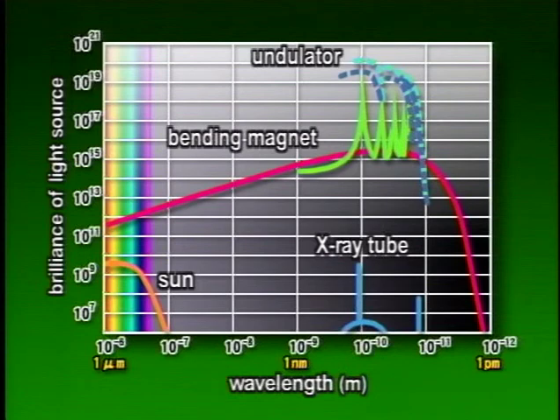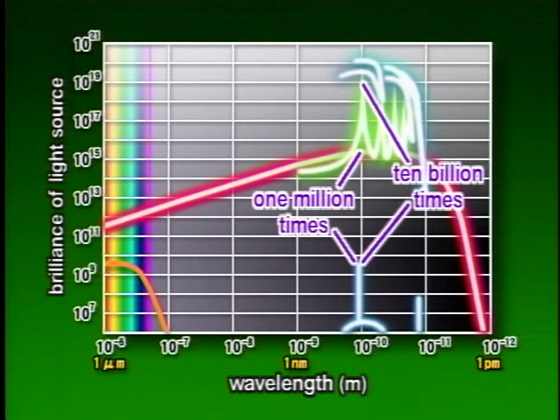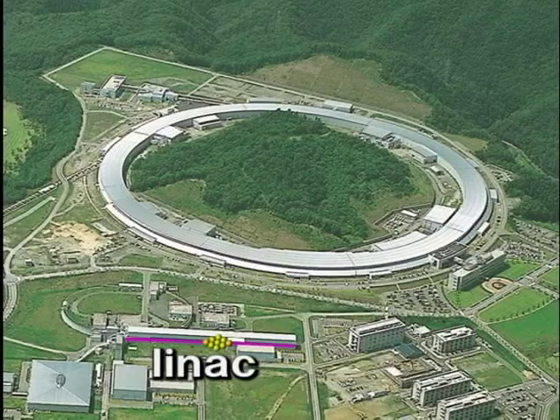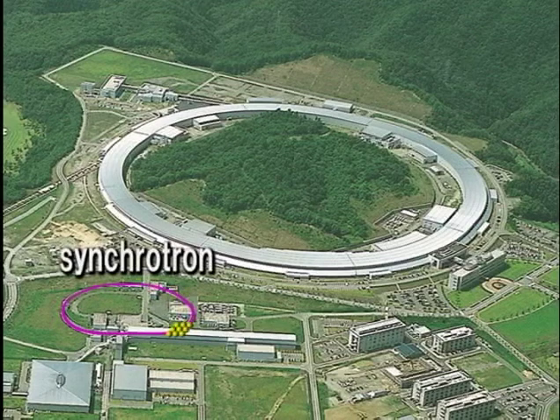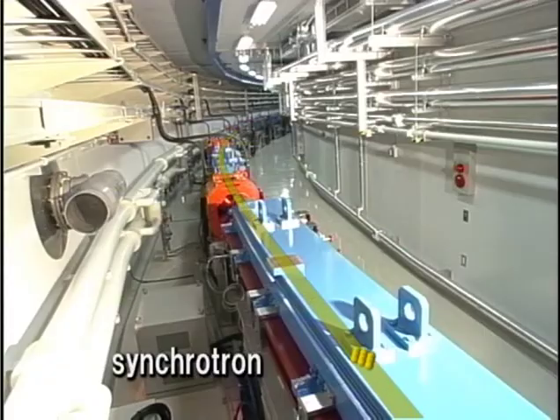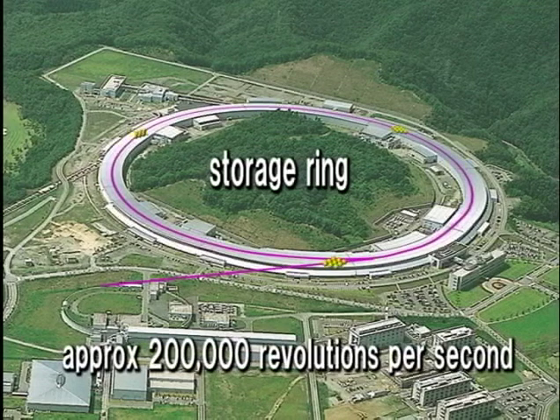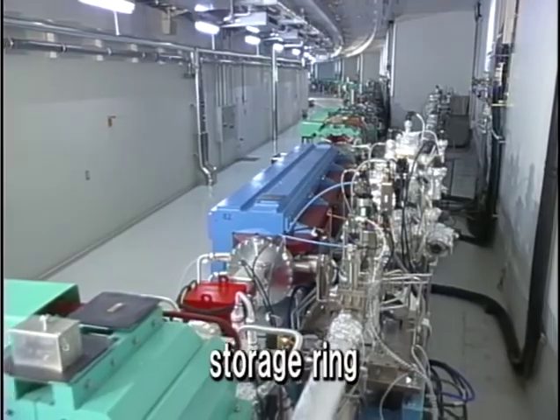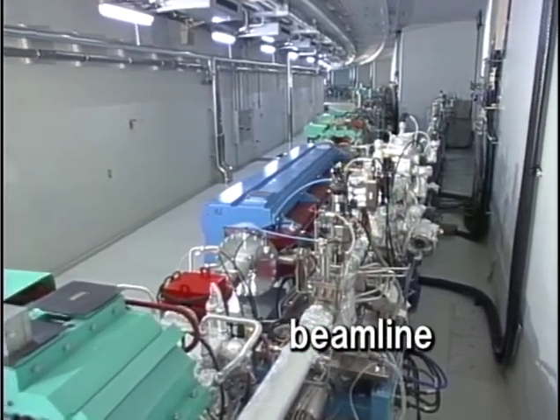Using these undulators, Spring-8 produces X-ray beams 1 billion to 10 billion times brighter than those from conventional X-ray tubes. At Spring-8, electrons generated by an electron gun are accelerated to 1 GeV by a linear accelerator. Next, the electrons are further accelerated by a circular accelerator called a synchrotron to 8 GeV, after which they are injected into a storage ring. The electron beam in the storage ring continues to travel around the ring at almost the speed of light while emitting synchrotron radiation each time it is bent by the bending magnets and undulators. The 8 in Spring-8 refers to the 8 GeV energy that is achieved.